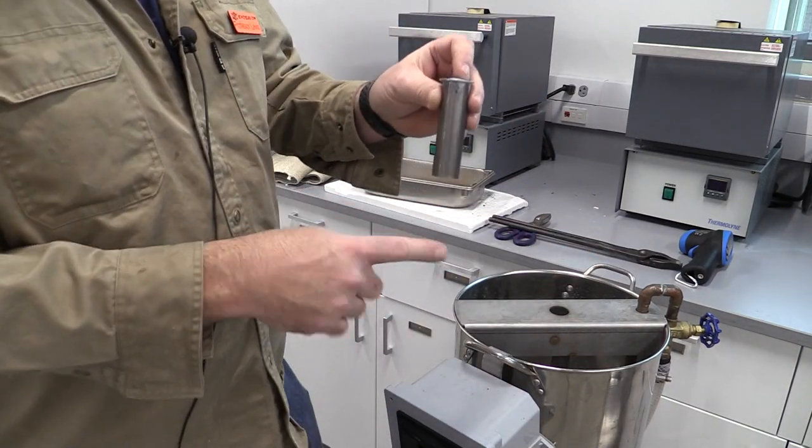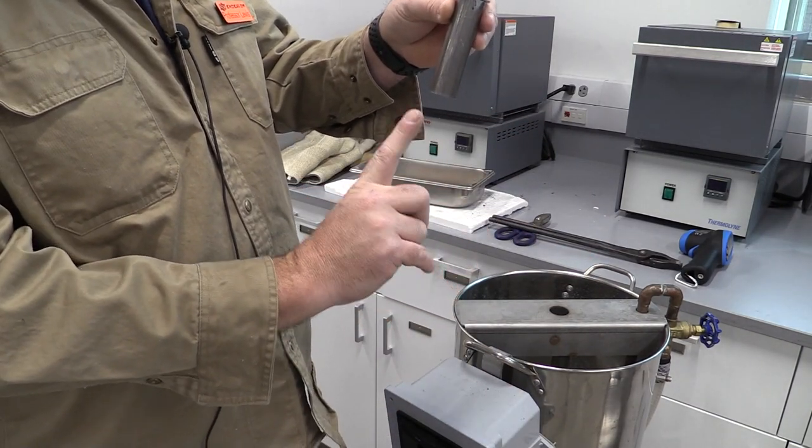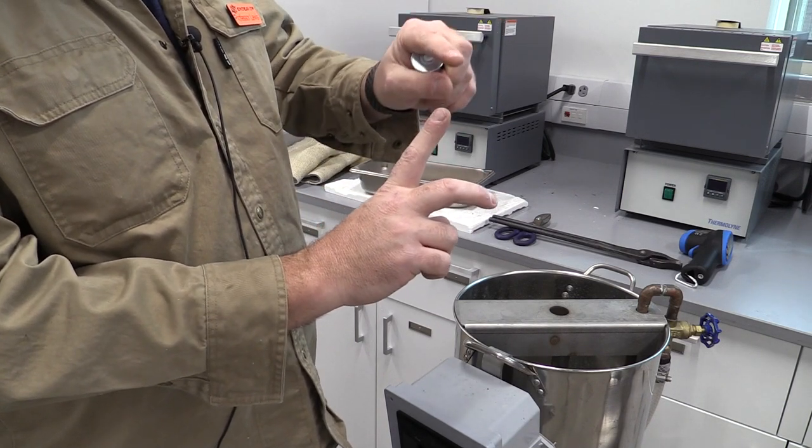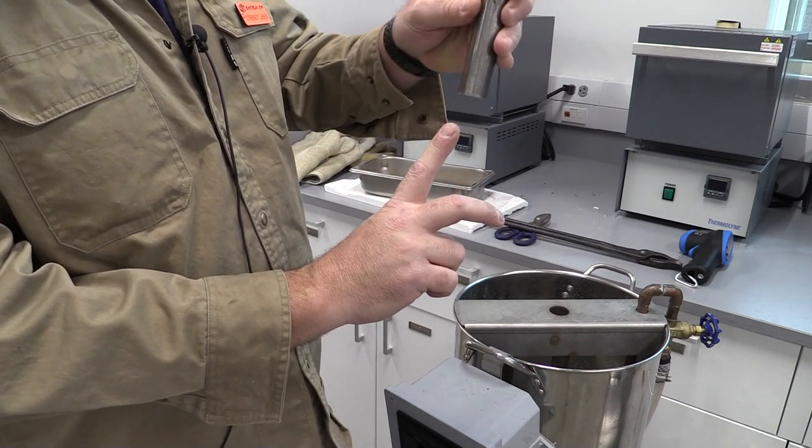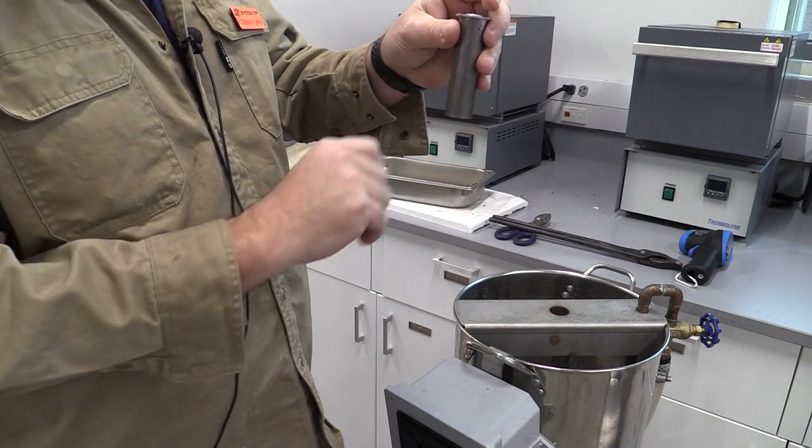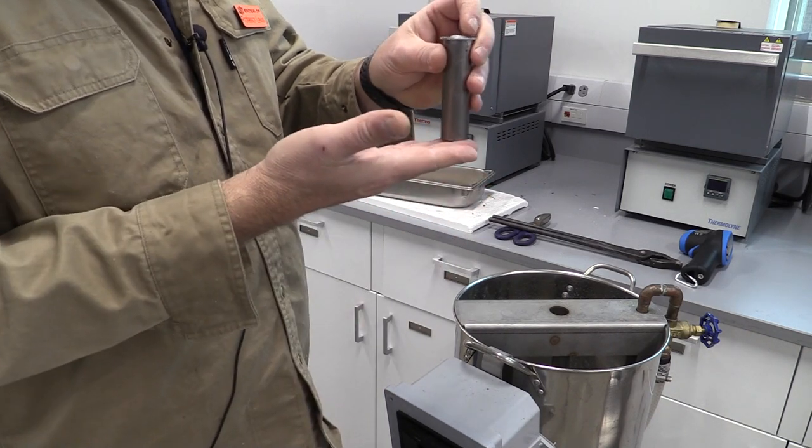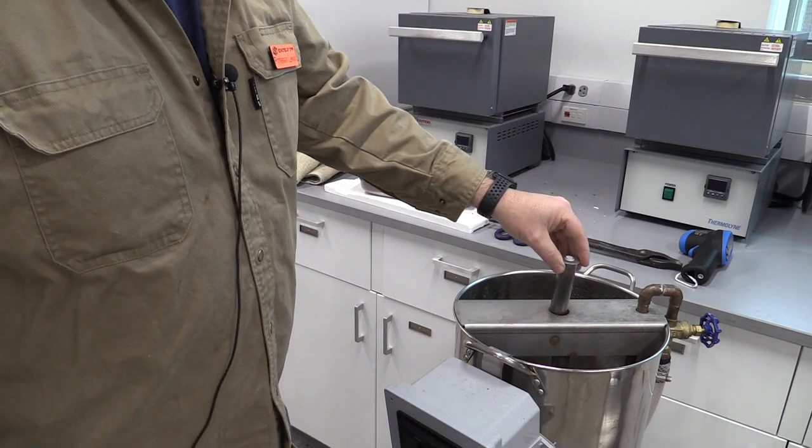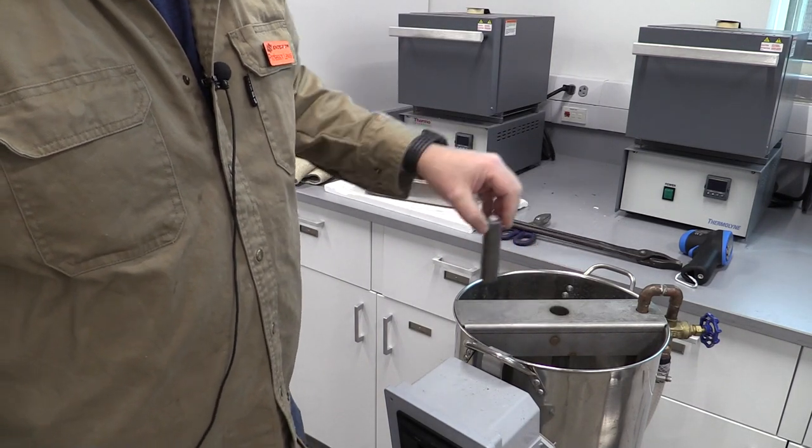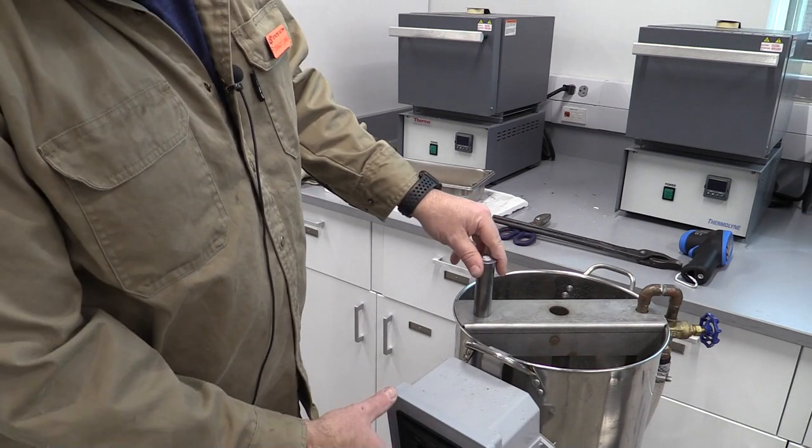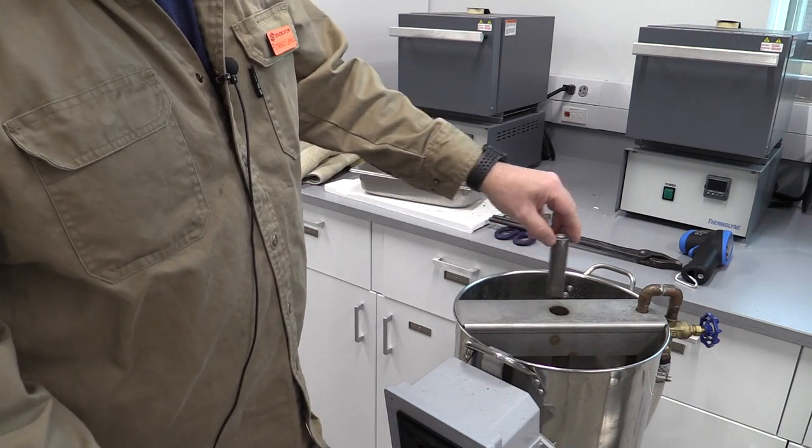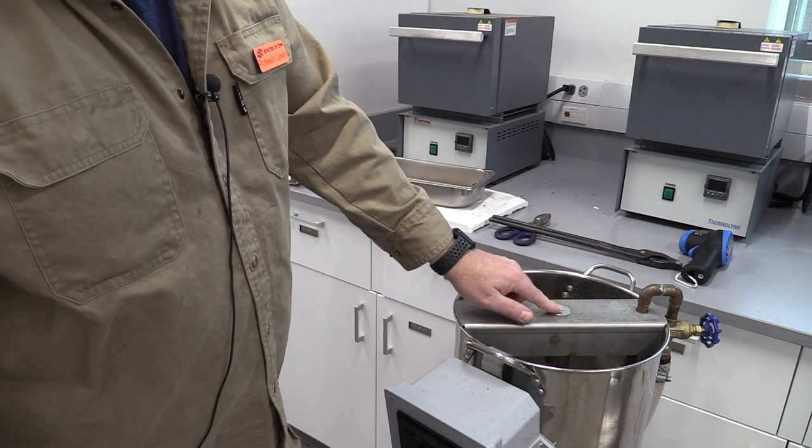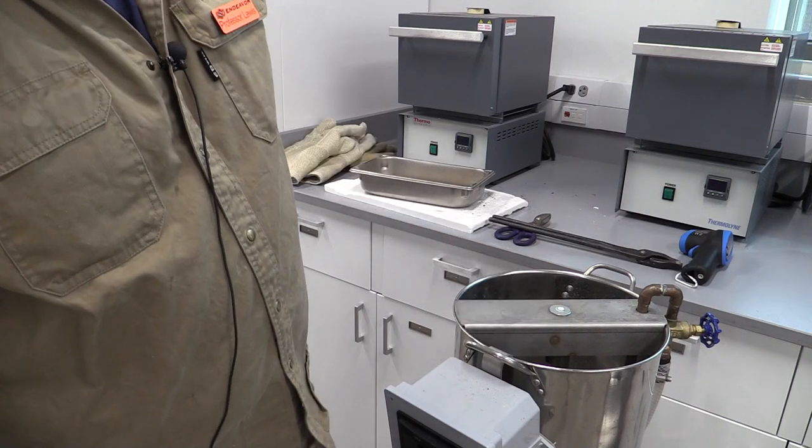Let's talk about what's happening here. The Jominy nozzle is going to be a half inch, so my fingers representing the nozzle half inch down - without the sample in there we want the water to extend a full inch from the nozzle. That way we have a half inch impingement of the water on that sample. That's going to ensure constant flow rate at half inch diameter, half inch engagement. We're going to make sure we have our water adjusted on the stand. We're doing all this while it's soaking in there. I recommend leaving a test sample in here when you get ready to turn it on and test it, because when I turn it on without that sample, the water is going to shoot way up in the sky.